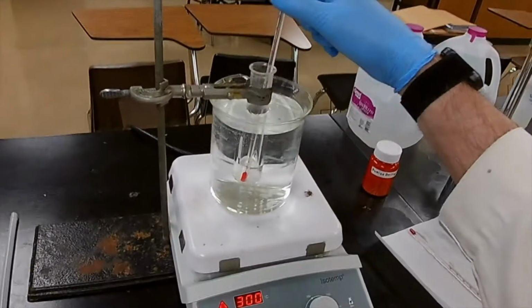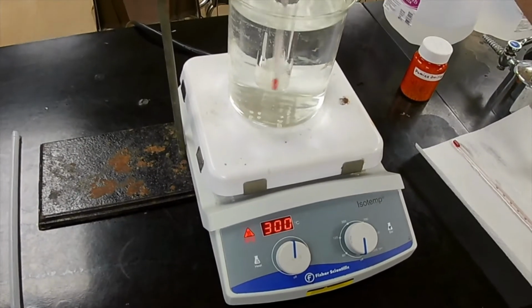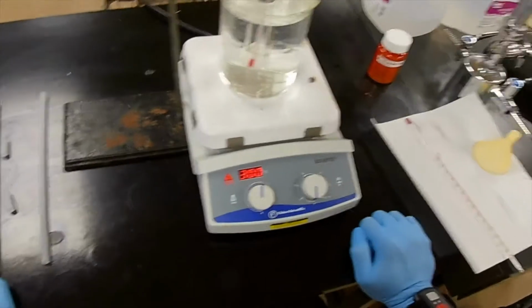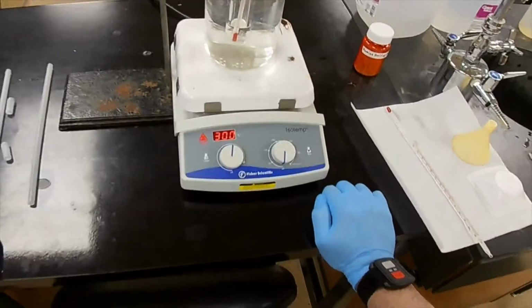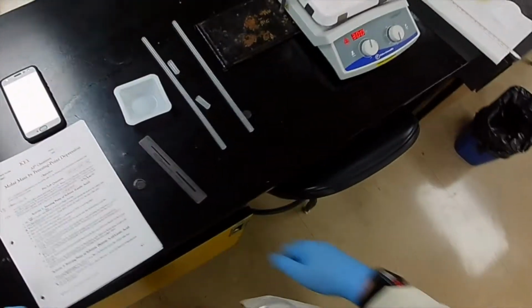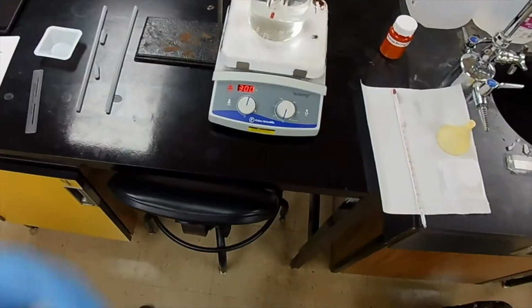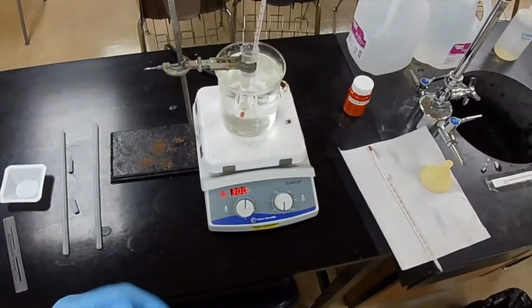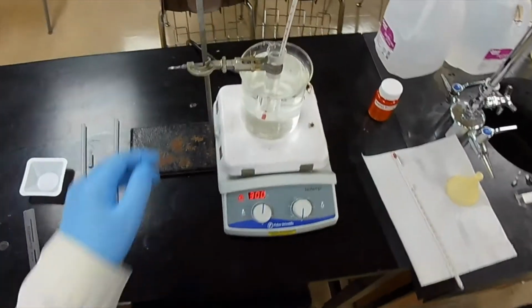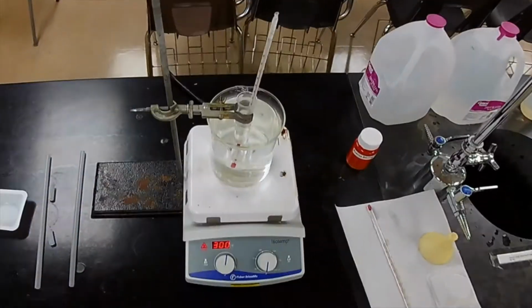I see the lump smaller. Now it's 2 lumps. Now it's 3 or 4 lumps. Okay, we're getting there. So what are we going to do when it is melted? When we're satisfied that the lauric acid has been liquefied, we will pull the thermometer, the tube, and the clamp out of the water and move it away from the heat source.